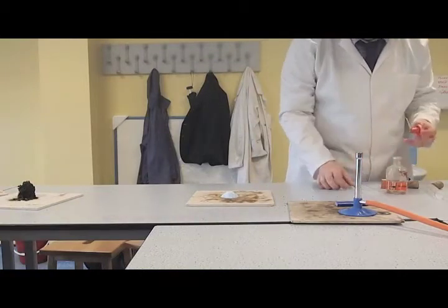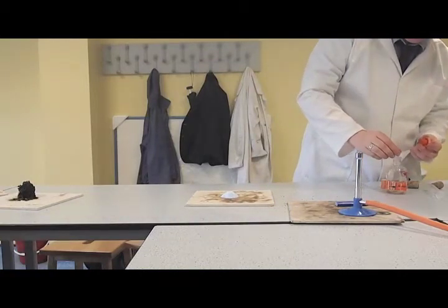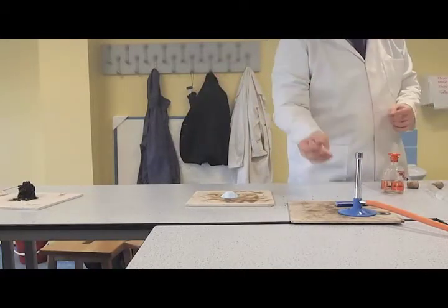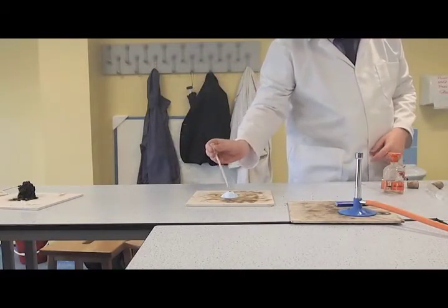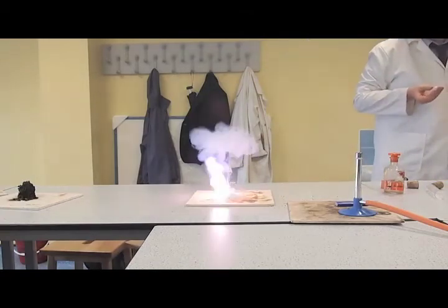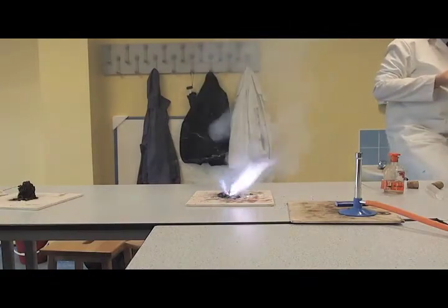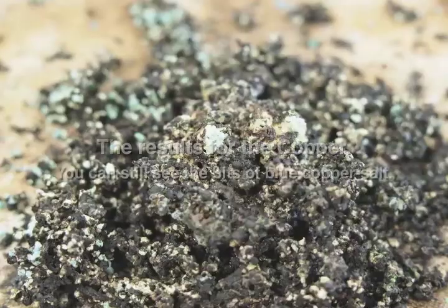So, last but not least, is this going to turn green? When we did this one, it was green. So this one now should be green. Wow! It's white and pink. Oh, that's cool. It's alive.